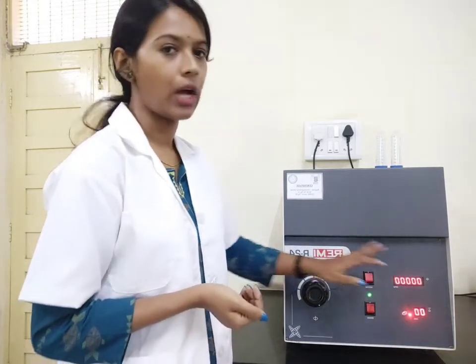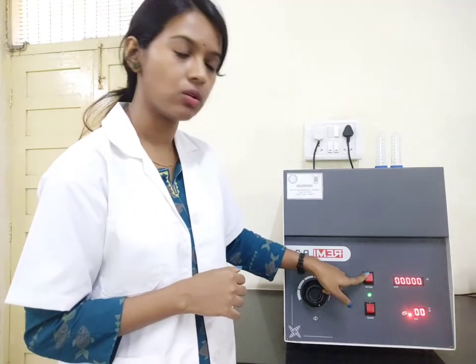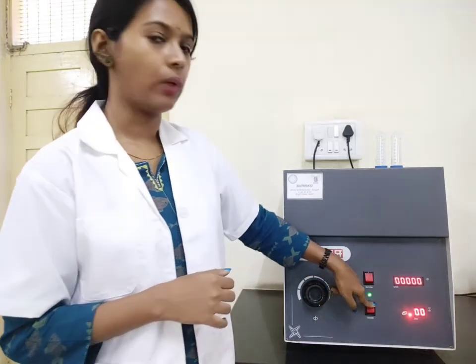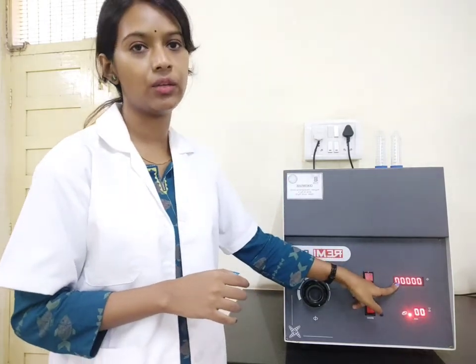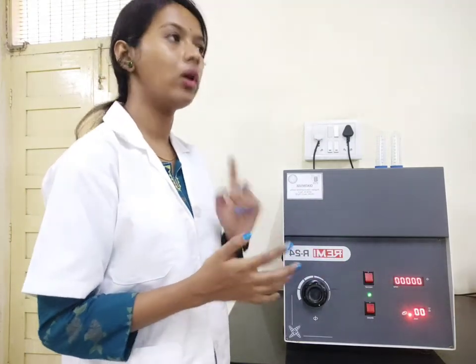Once everything is set — your rpm is set and your time has been set — the next thing is to turn the instrument on. You can see there are two more buttons. The first one is for the motor: once you turn on this switch, the motor will start rotating at speed. The second one is the brake. Once you set the instrument at 8000 rpm for 10 minutes, automatically after 10 minutes the speed will come down to 0. In case you want to stop earlier, you can turn off the motor and turn on the brake — the speed will get reduced and come back to 0.